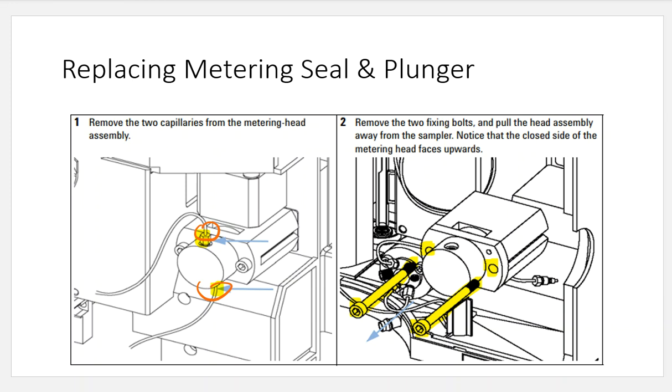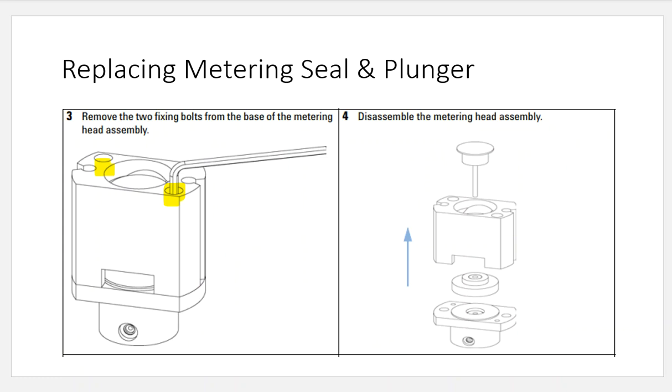And then I will take an Allen wrench or a hex wrench and I will go in here and loosen these two screws. Those two screws are holding the analytical head in place. So I'm going to take those out. I've highlighted those in yellow, and then I'm going to remove the entire stainless steel piece altogether. When I remove that stainless steel piece, just like on the analytical head, there's going to be a screw here and there's going to be a screw there that's going to hold this device in place. So I'm going to loosen these two things up.